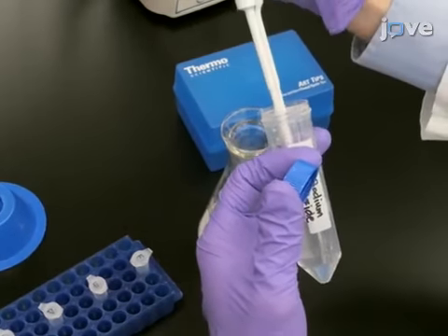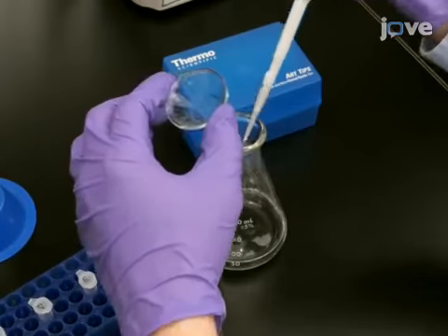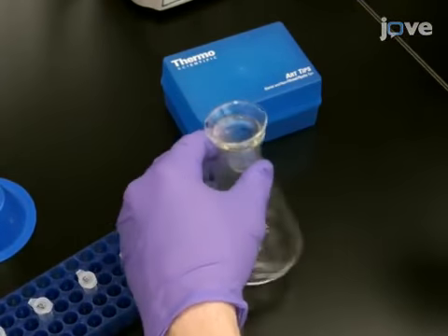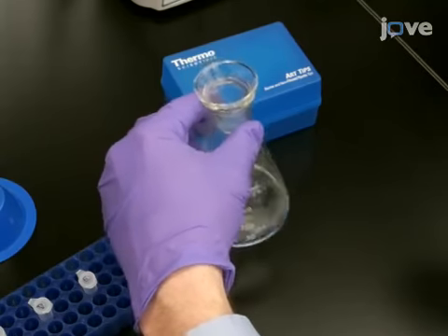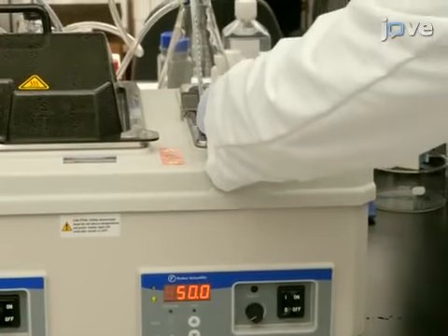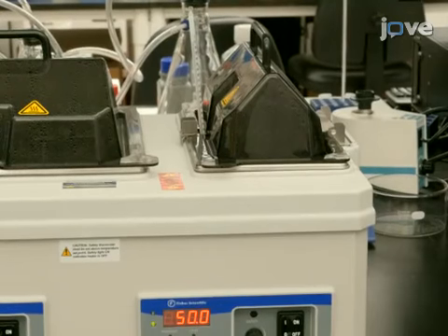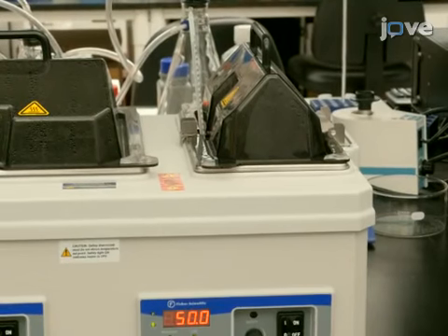To inhibit contaminating bacterial growth during incubation of the assay, add 50 microliters of 10% sodium azide in water to the agarose solution and adjust the temperature of the solution to 50 degrees Celsius in a water bath. If viable cells are used as the substrate, omit the sodium azide from the agarose solution.